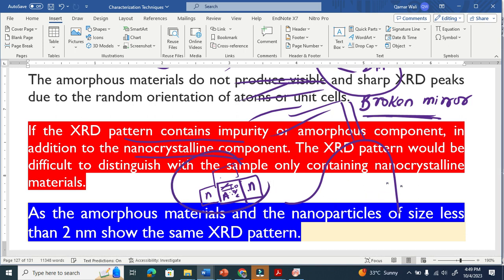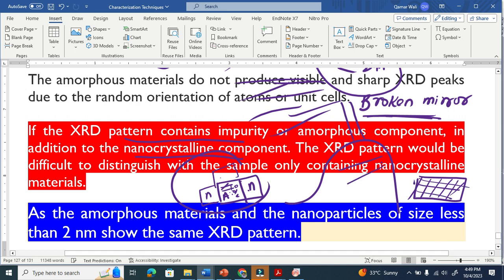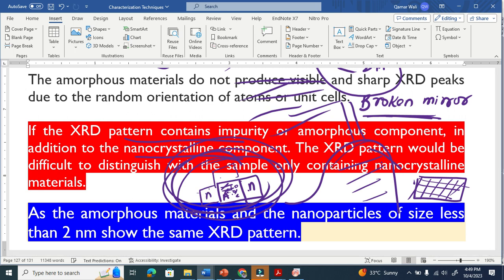Let's compare this with only nanomaterial. This is a completely crystalline nanomaterial. It also gives the same pattern. And in the other case there is the impurity or amorphous nature in the material. So how will you differentiate that my material has no impurity, that my material is a pure crystalline material, because in both cases you get the same XRD pattern?